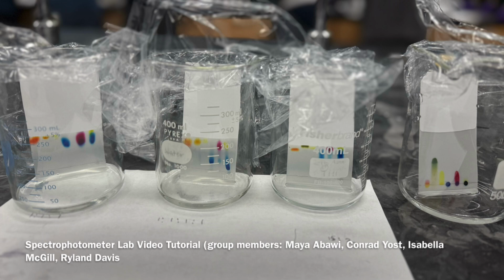So in case you don't know, this lab involves a knowledge of the Beer-Lambert law. Now, I'll explain it to you right now. It won't make that much sense, but you will need to keep it in mind for later. Trust me, this can be really important.